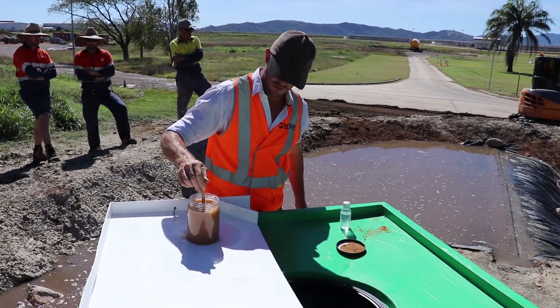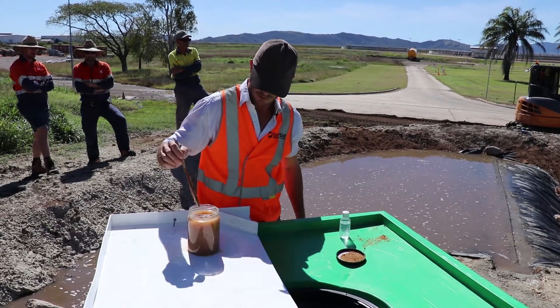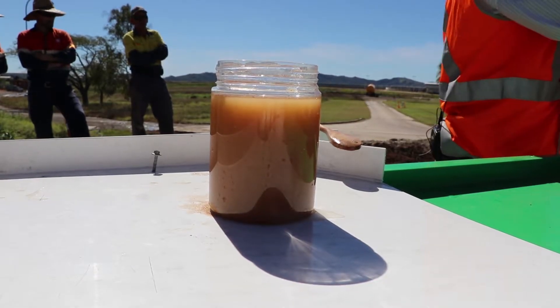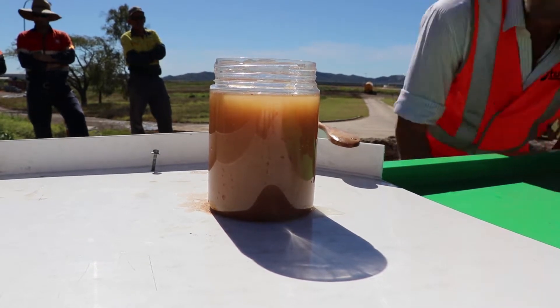And I give it a stir. You can see in the jar as it starts to flocculate out — it starts from the top as the cleanest bit.